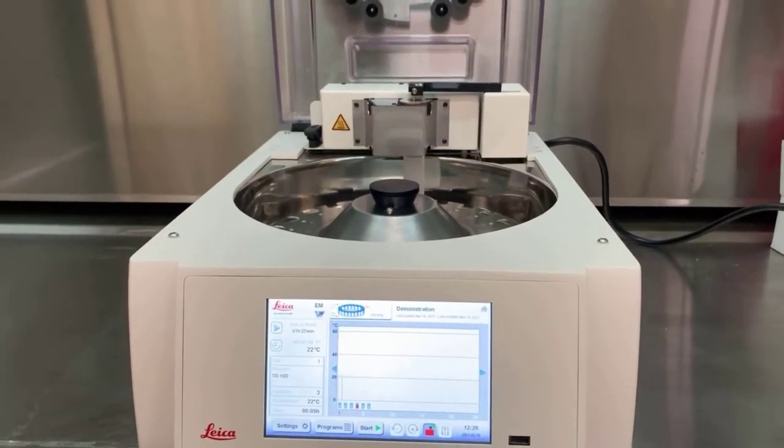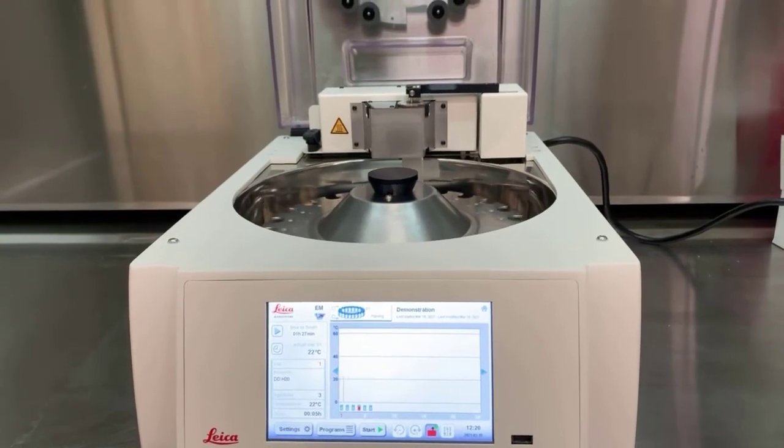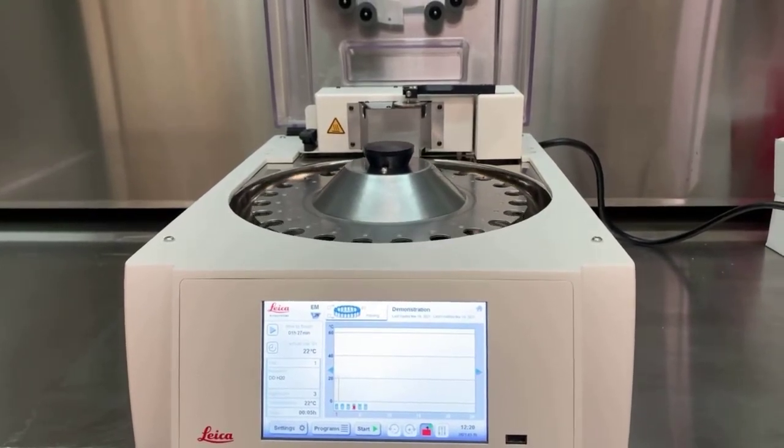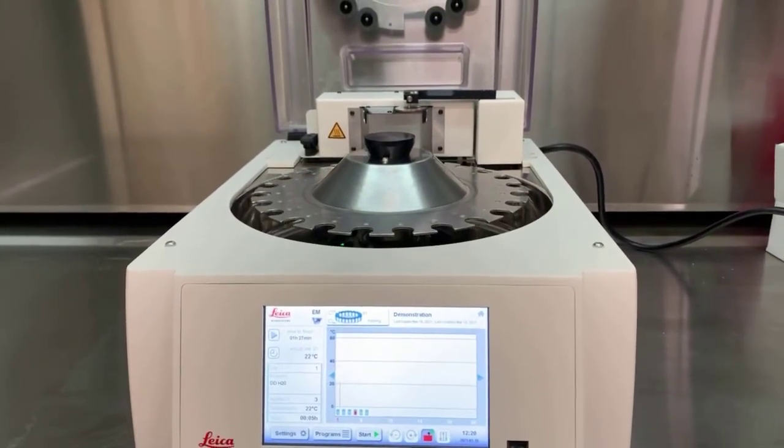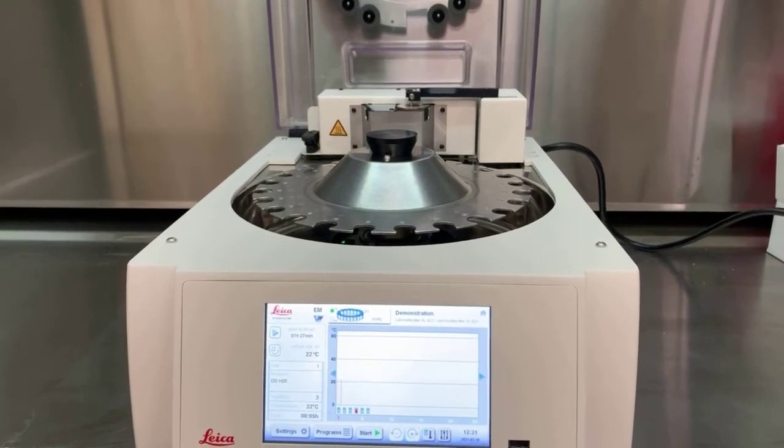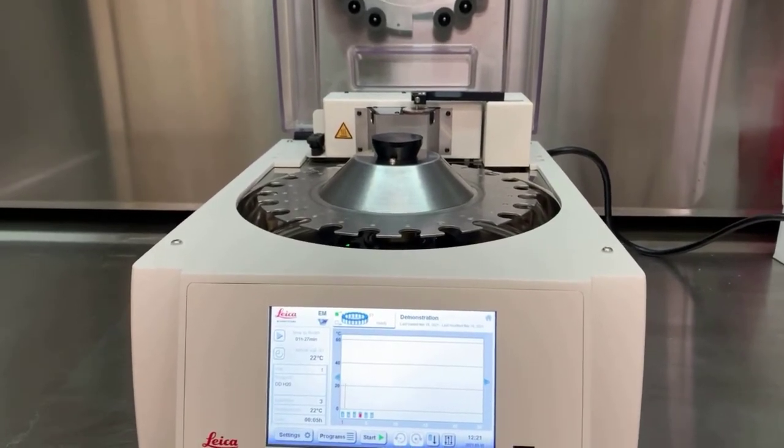With a fully loaded set of samples and the remaining components of the EMTP setup, it would be time to close the lid and start a program.